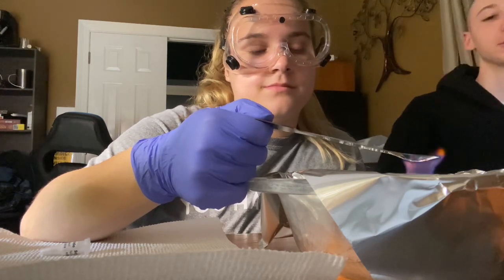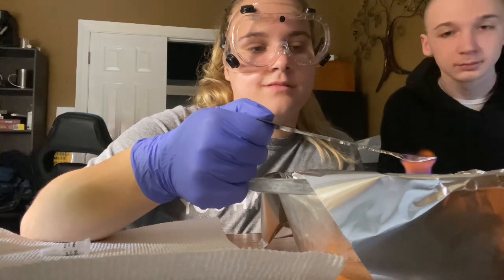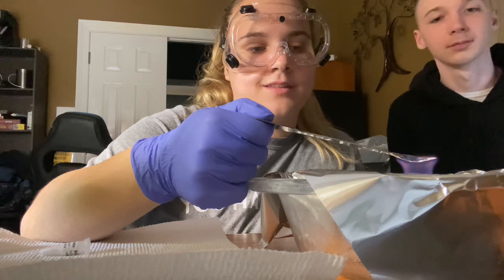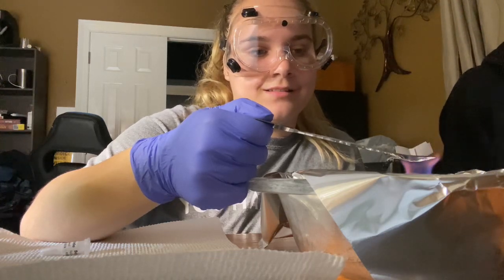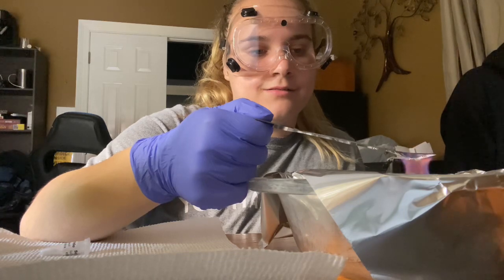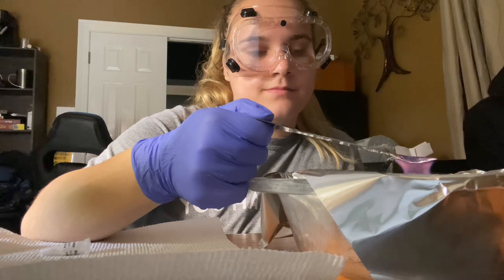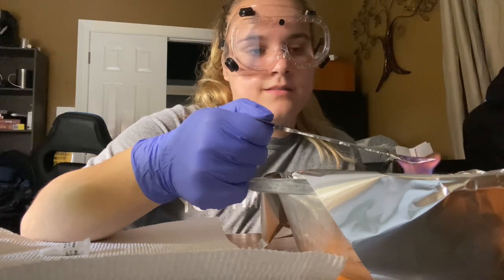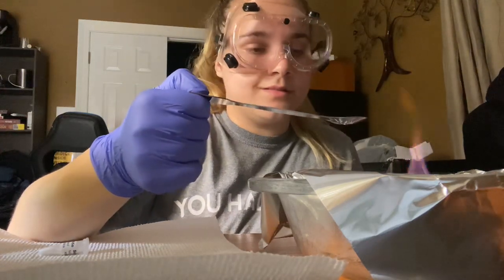No, its bonds are too strong, babe. Oh. Yes. Yeah, it's falling in there. It's probably the residual potassium iodide. It's not sodium. Alright, well, let's just say that salt has no color.